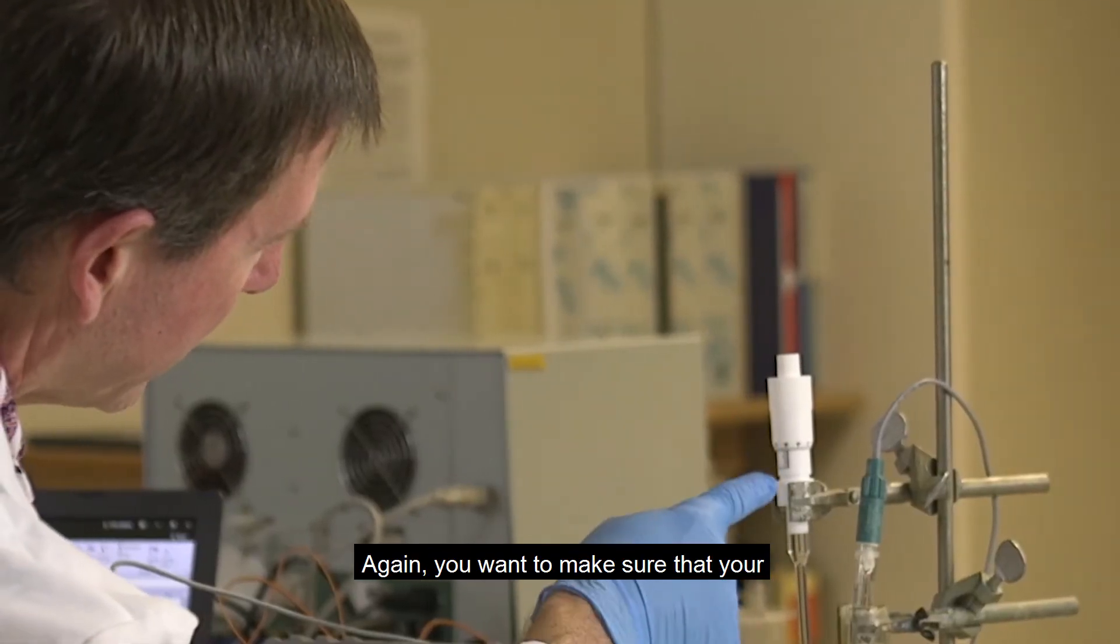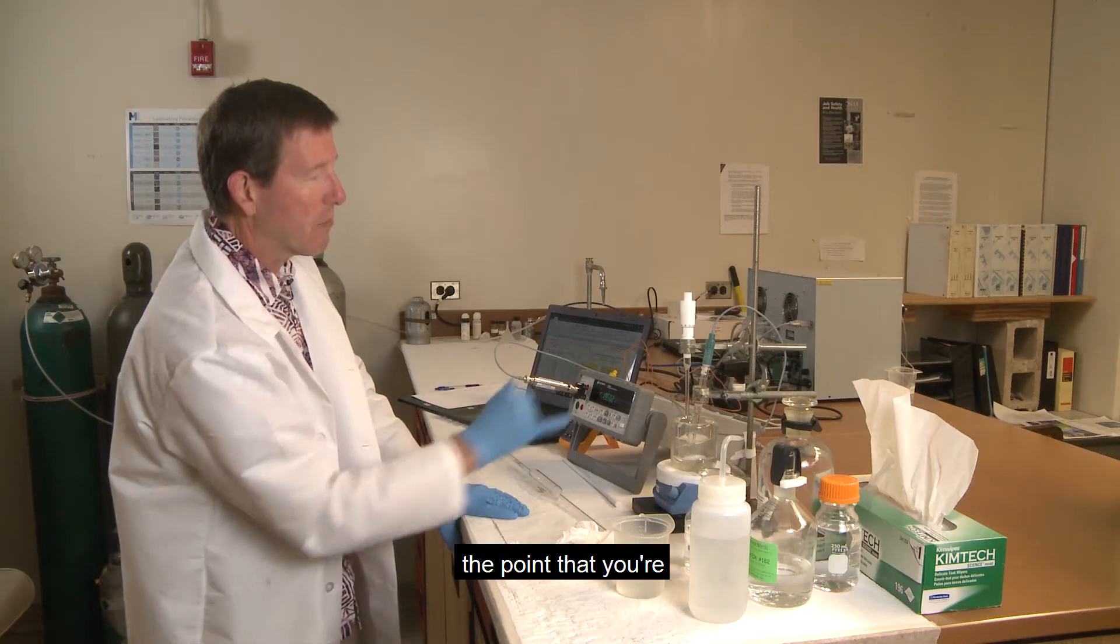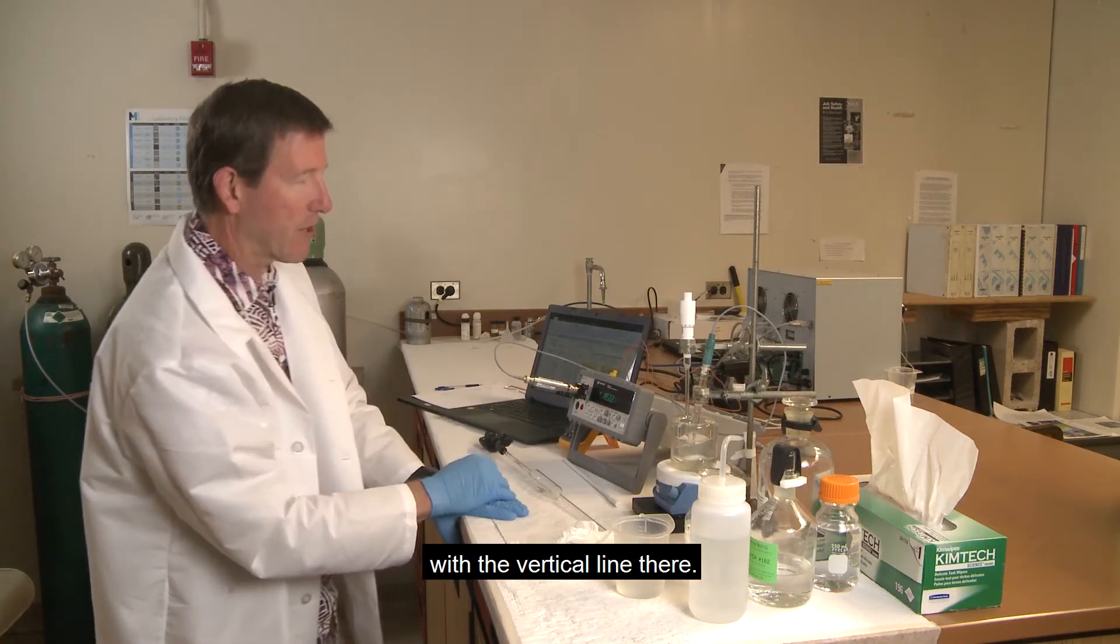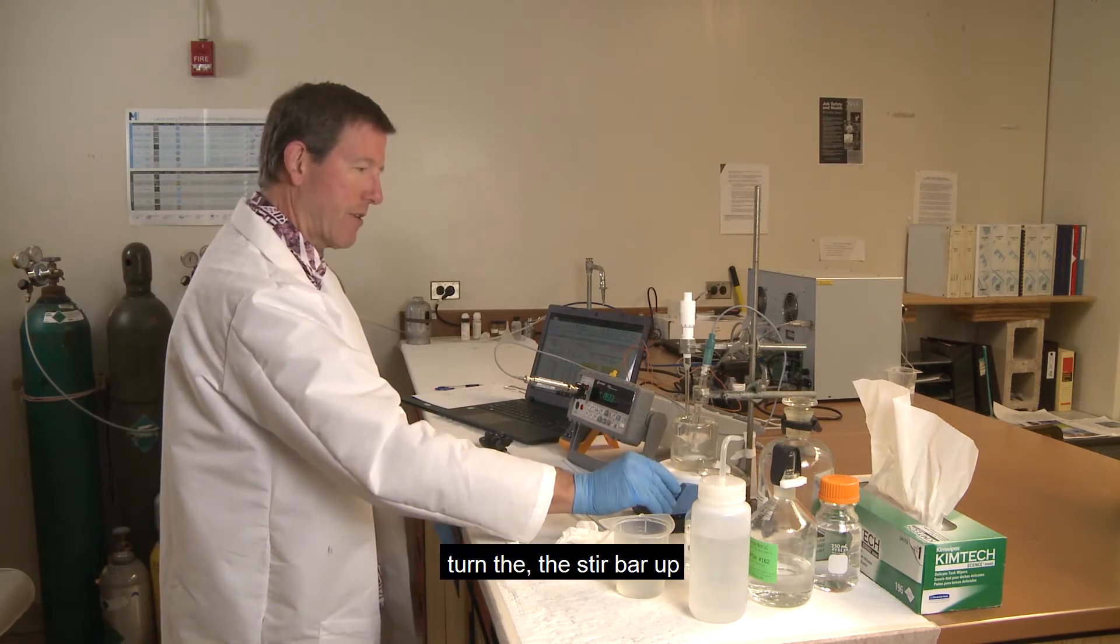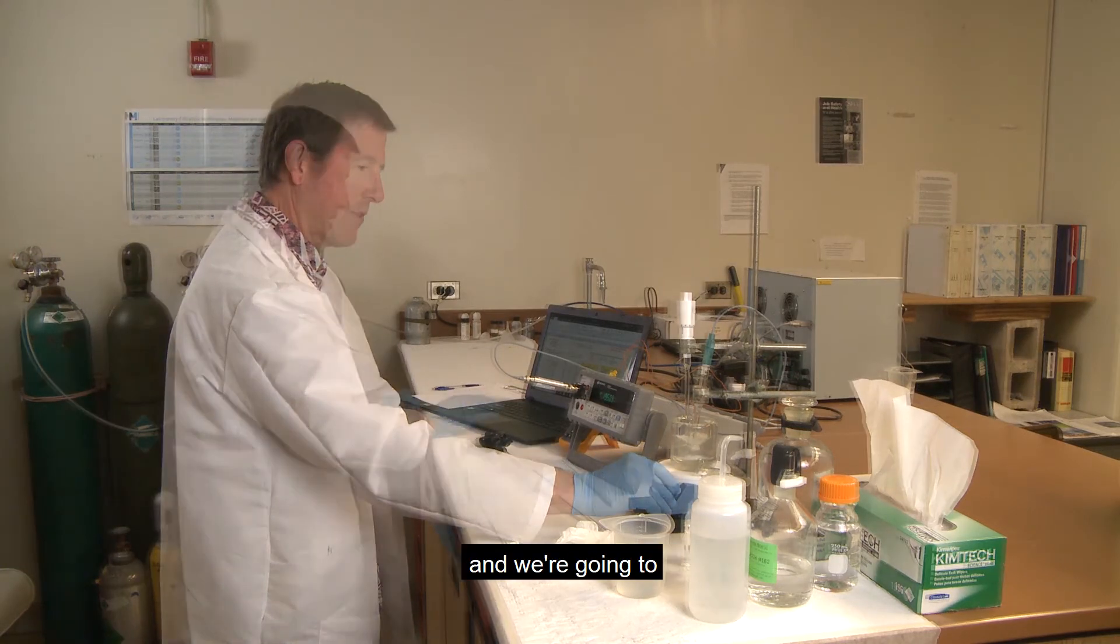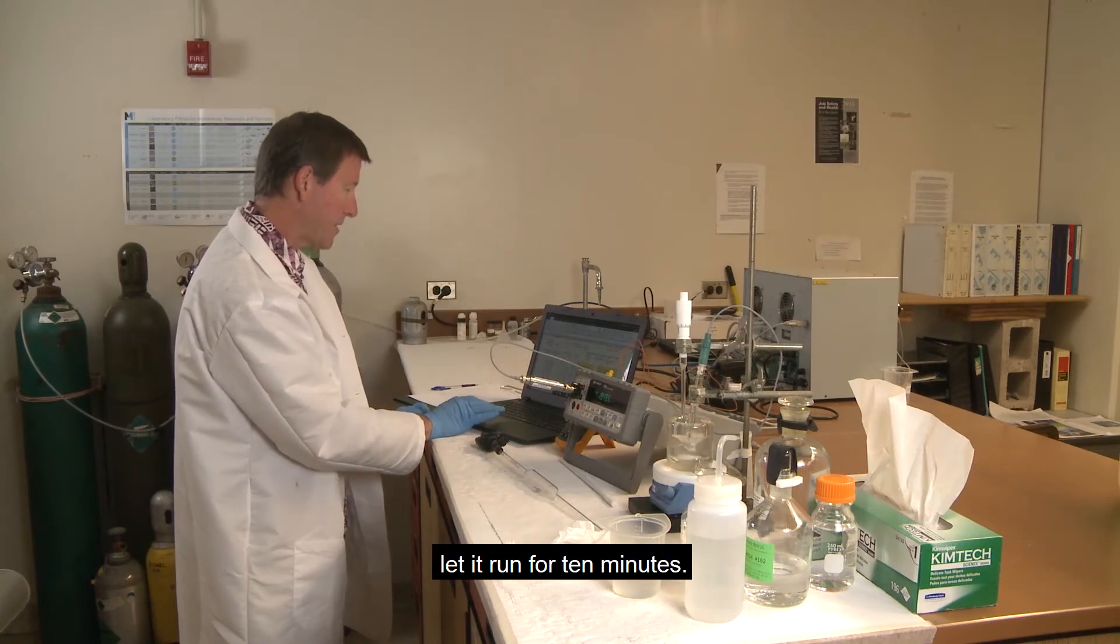Again you want to make sure that the point that you're comparing is lined up exactly with the vertical line there. So now we're going to turn the stir bar up and we're going to let it run for 10 minutes.